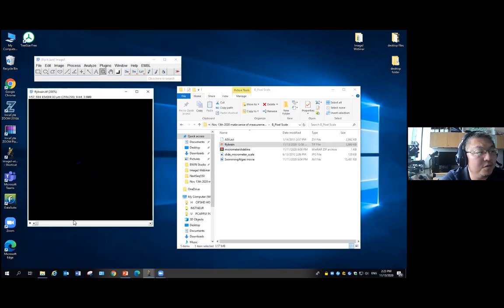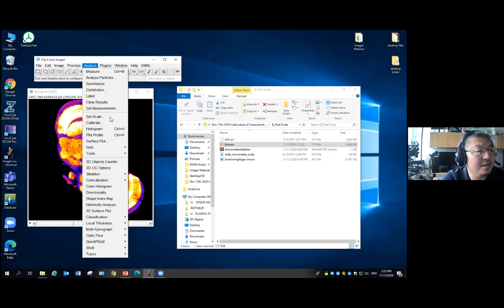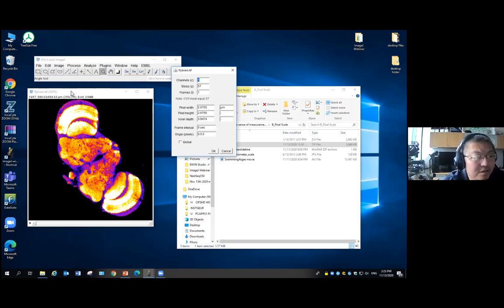Also, if I go to the FlyBrain here, we know what the pixel scale is. If you want to put a scale bar in it, you can go to the Analyze tools, the same place where you found the ROI manager, there's a scale bar. Then you can say, I want to add a scale bar every 100 micron, and put it in the upper right position. I don't think ImageJ has a very good scale bar function. It's very fundamental, just drawing a line. If you want a better scale bar, you can do that in other software or in Photoshop. But as long as you know what the pixel scale is, you can add the scale bar in any other software.